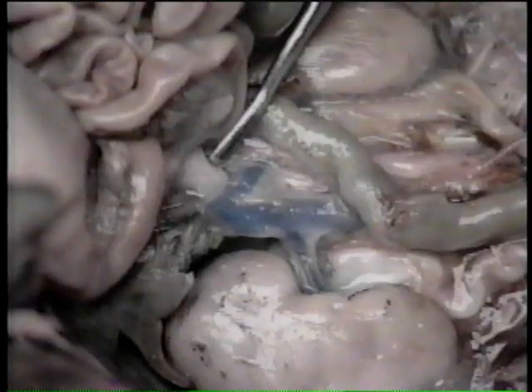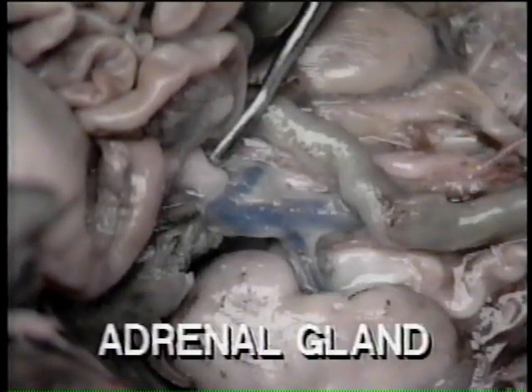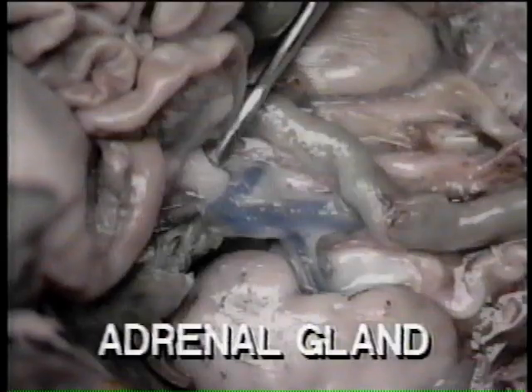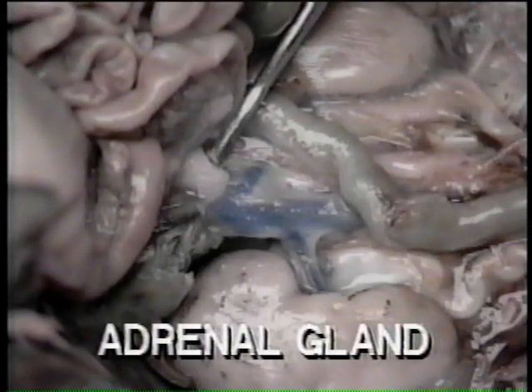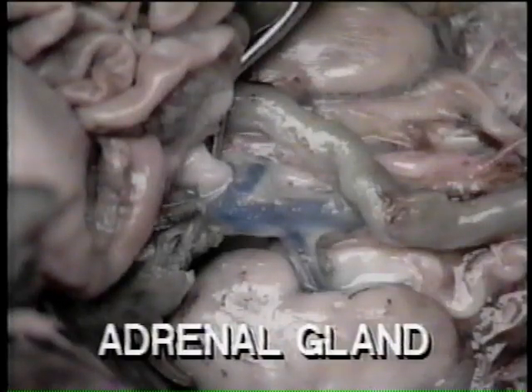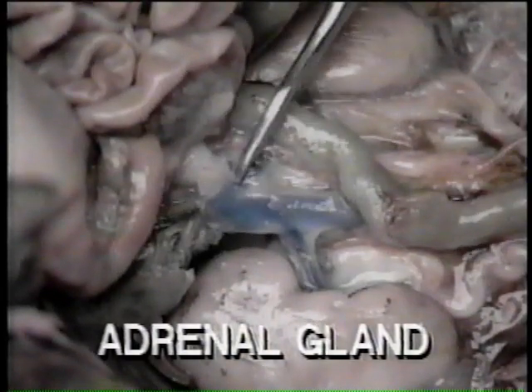Next, look on the medial face of the kidney for the adrenal gland, which is part of the endocrine system. Hormones secreted by the adrenal glands go directly into the bloodstream and help to control a number of bodily functions such as heartbeat, regulation of blood sugar level, and development of certain secondary sexual characteristics.